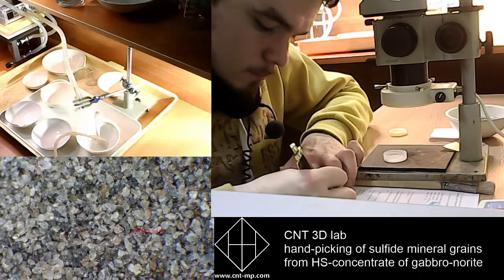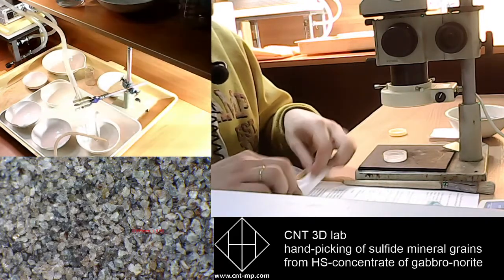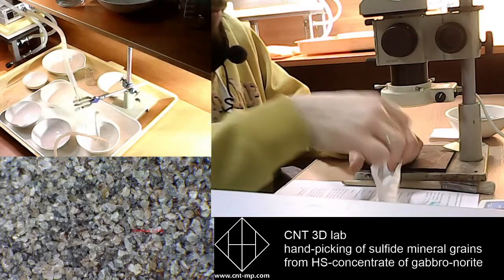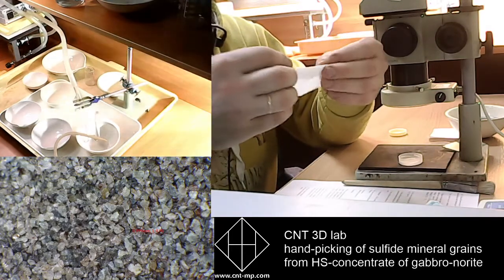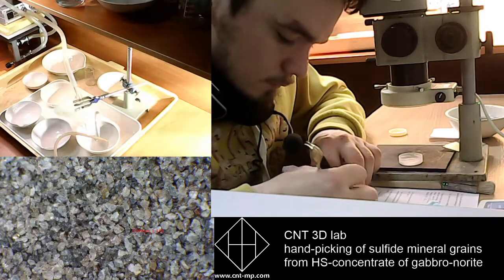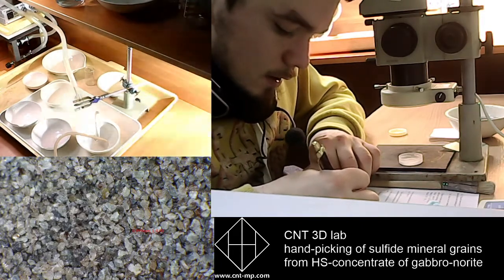Sulfide. So we just move all grains into our paper bag. Also, I would like to write down the fraction of sulfides we see here. It's minus 0.5 plus 0.125.